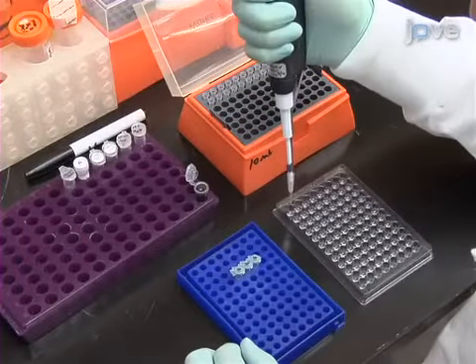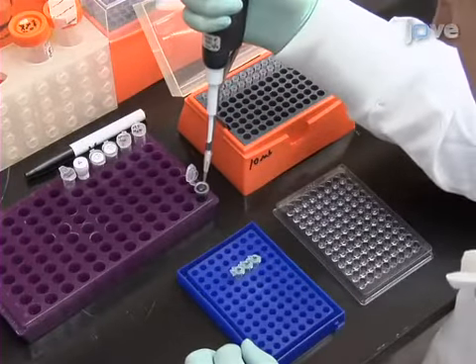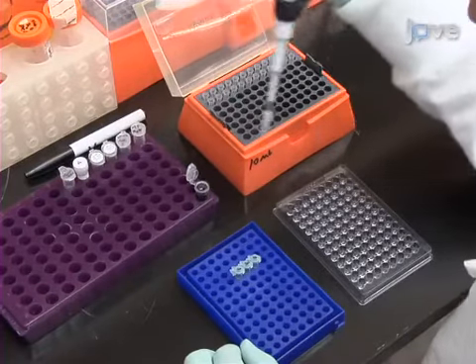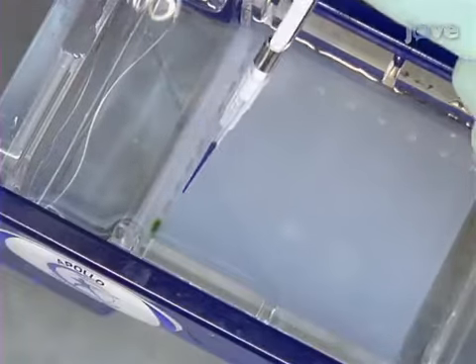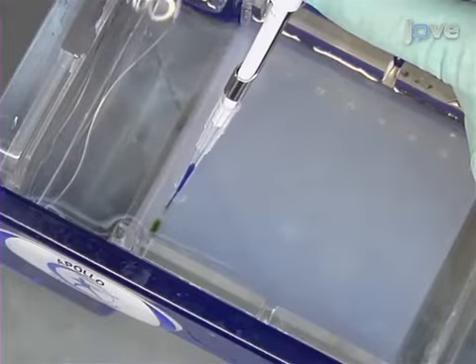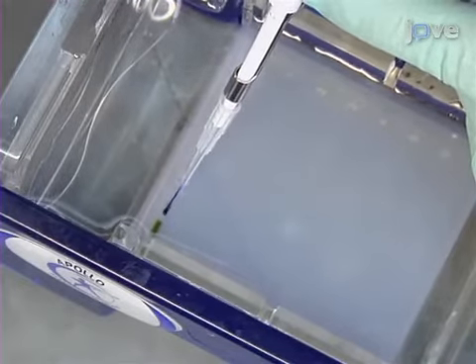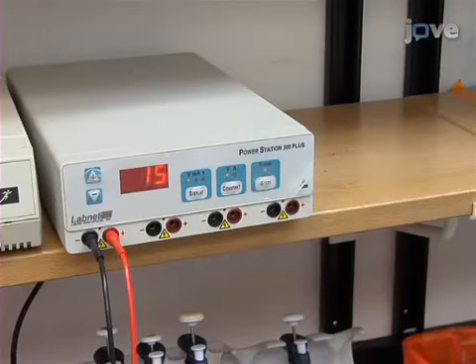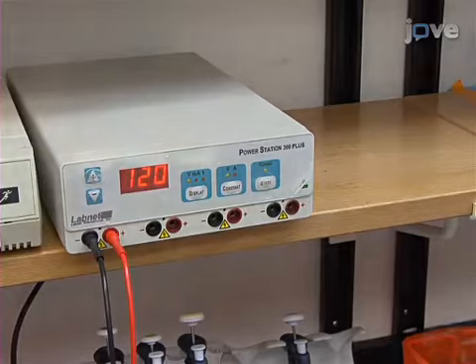Next, add 3 microliters of 5x loading dye to 5 microliters of the second round reaction volume. Run it at 120 volts on a 1% agarose TAE gel containing a UV fluorescent DNA stain until the bands are resolved. Then, visualize the 1.6 kb bands on a blue light illuminator.